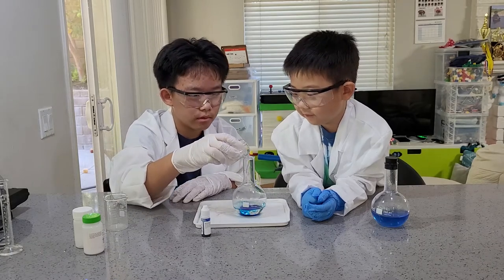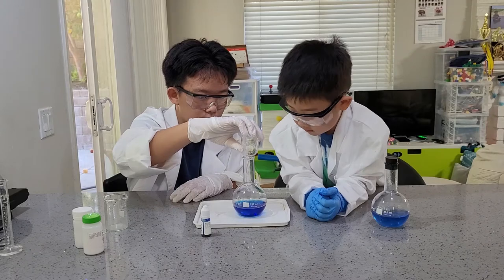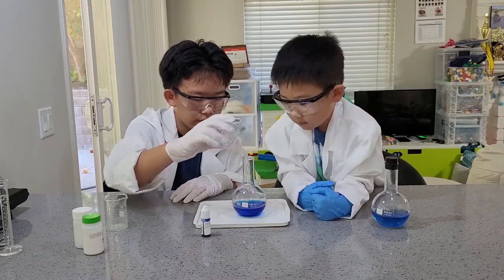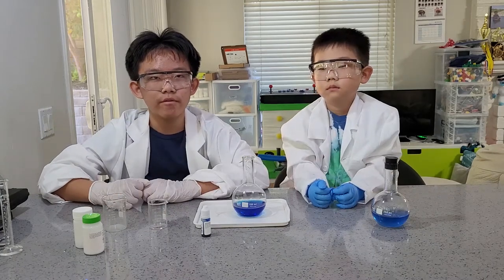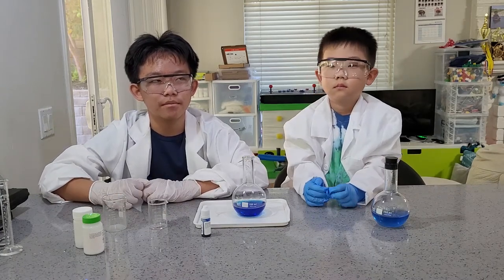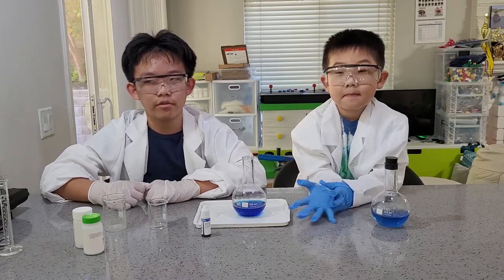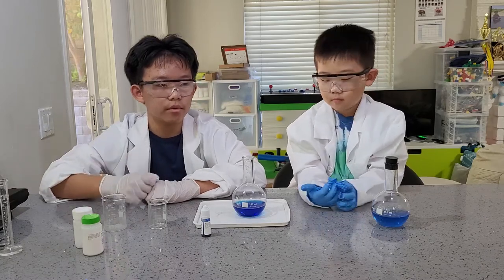Let's add our alkaline glucose solution. How does this happen anyway? Just let the methylene blue spread out. Now let's wait for the solution to turn colorless. The reaction here is known as a redox reaction — the glucose is reducing the methylene blue.